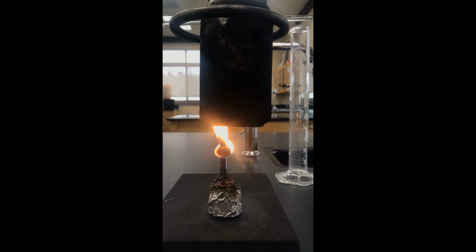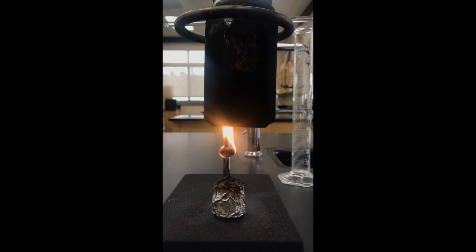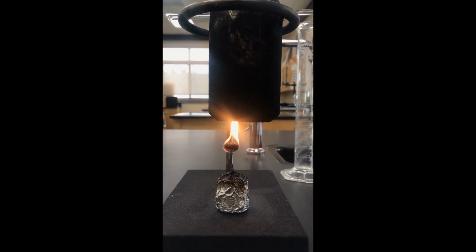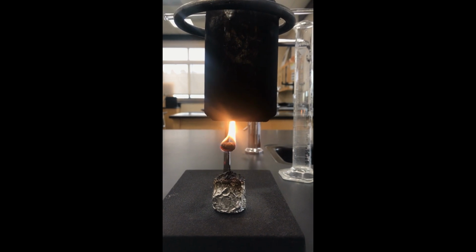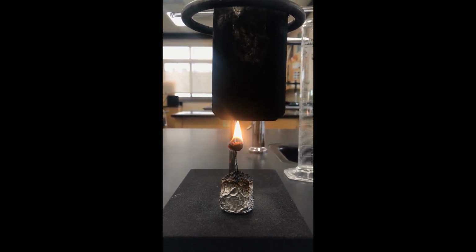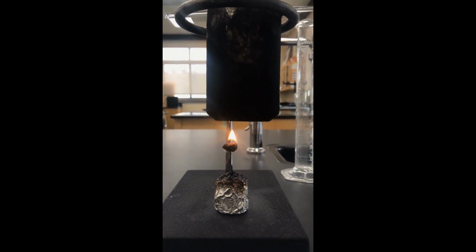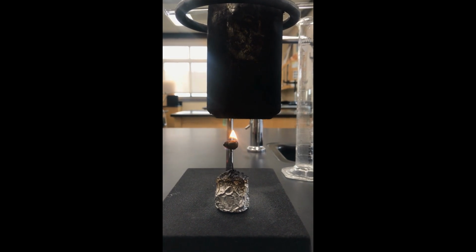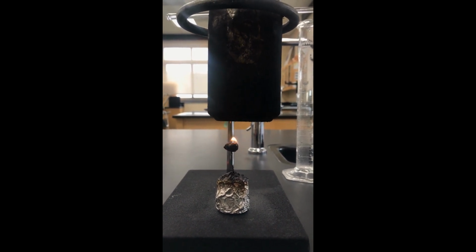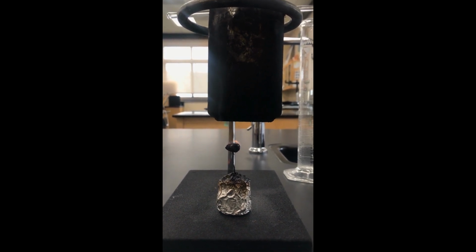Besides the calculation of calories, we can also make note of the amount of time it takes for items to burn up. That doesn't indicate necessarily the amount of energy, but it does tell us the amount of time that the energy would last in the body, so how quickly it would burn up. You may have heard of foods that contain a quick or a long-lasting source of energy. So this is not the amount, but it can give us some clues as to how long the energy would last. And that flame is starting to go out. We're almost there.